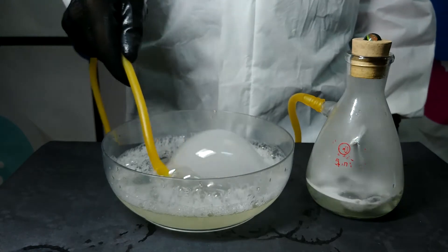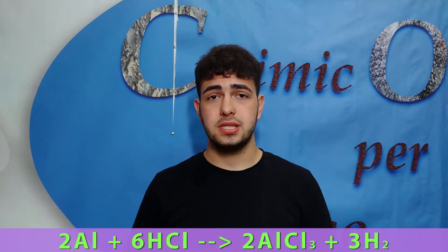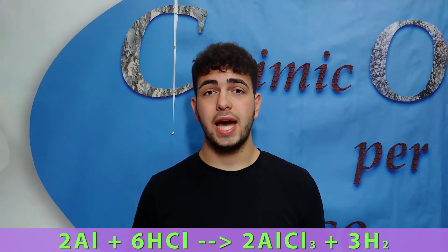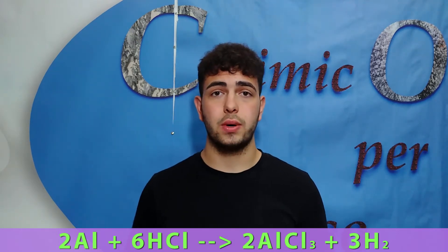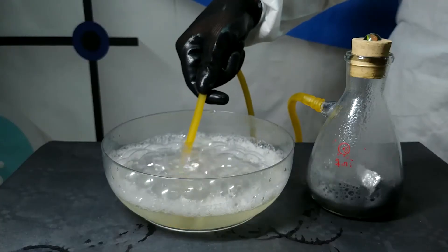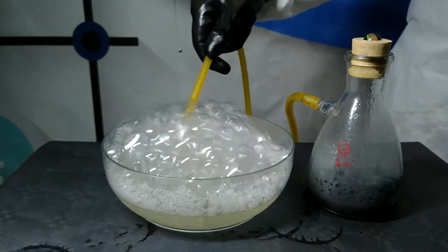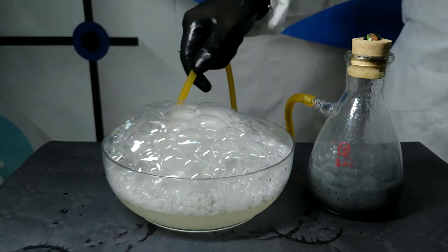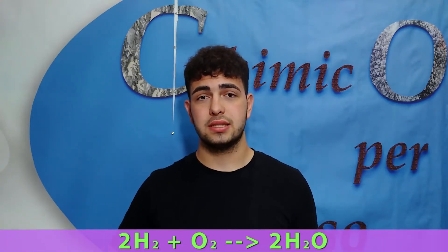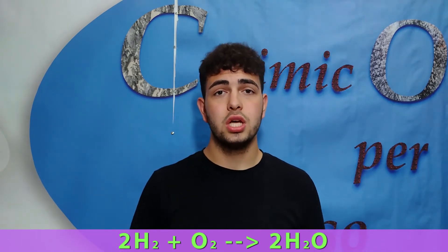So when we add aluminum foil to hydrochloric acid, this is the first reaction that happens. As you can see from the reaction of an acid with a metal, hydrogen is produced — a volatile gas — and it goes from our conical flask to our final recipient that contains water and dish detergent. As we know, hydrogen is a highly flammable gas, so it is enough to ignite it with a lighter or anything else to make the second reaction happen: the combustion reaction of hydrogen that reacts with oxygen to form water.